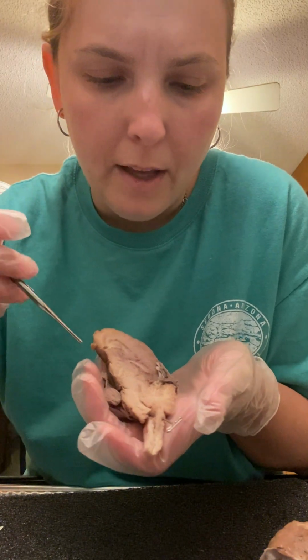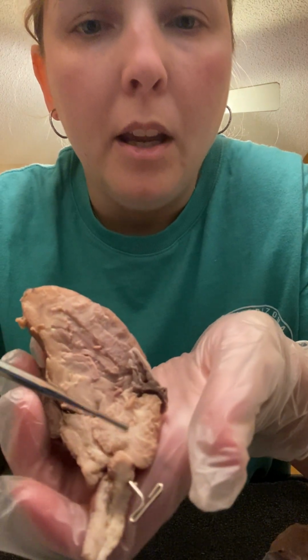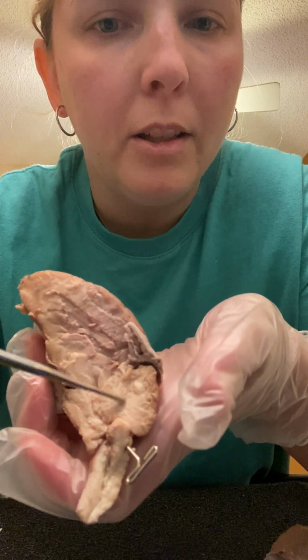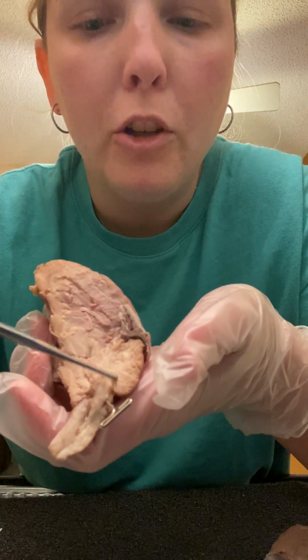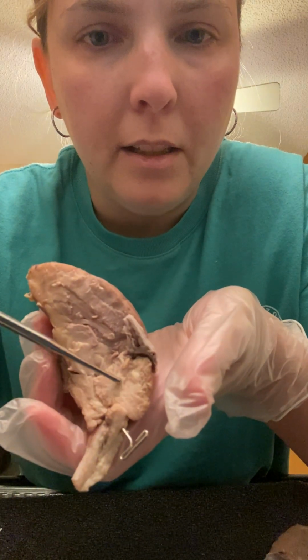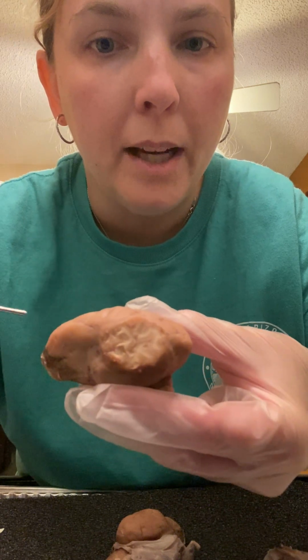And then the white matter, you can kind of see that in the cerebellum. They're almost like tree-looking parts that kind of come out from the center. That is your white matter, and then that contrasts with the gray matter in the brain. It's a little bit hard to see here because it doesn't contrast very well, but I have sectioned a piece of the brain, and you can clearly see the white matter here, contrasting against the gray matter of the brain. And that is my sheep brain dissection.